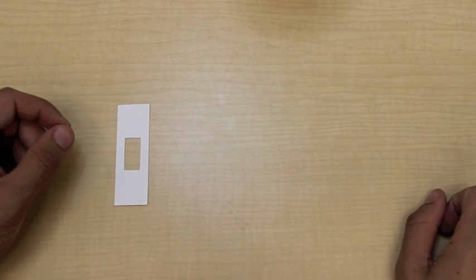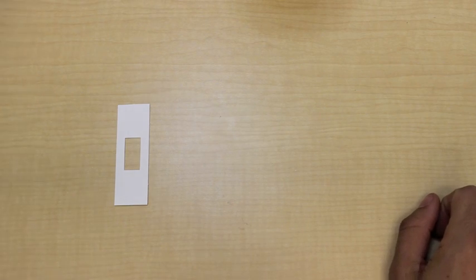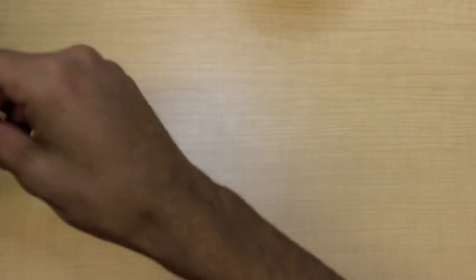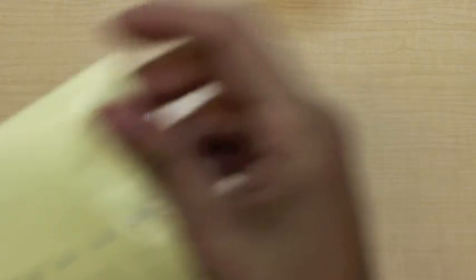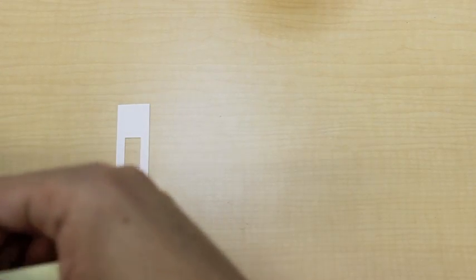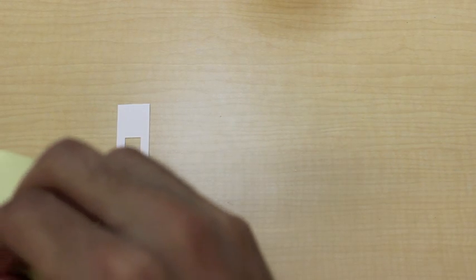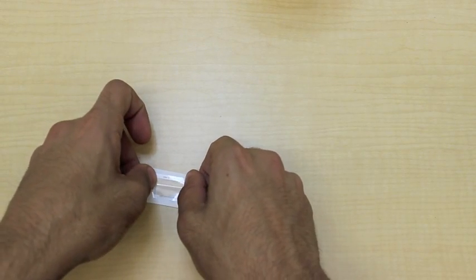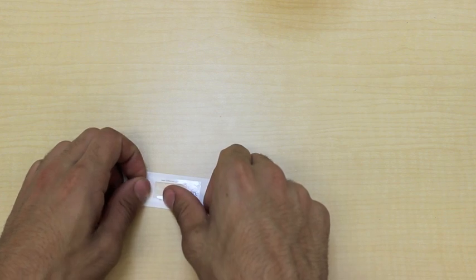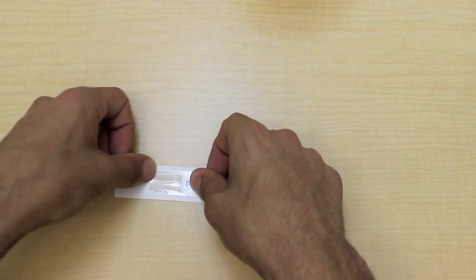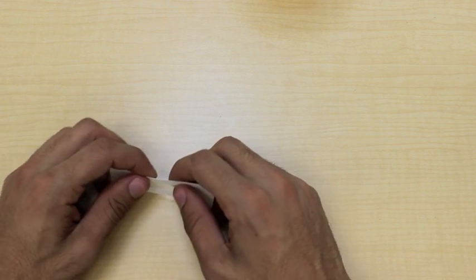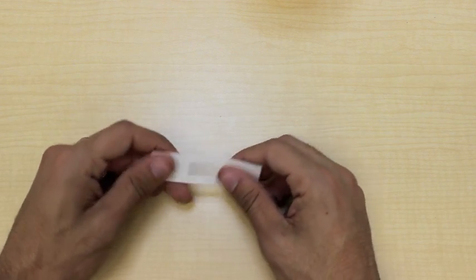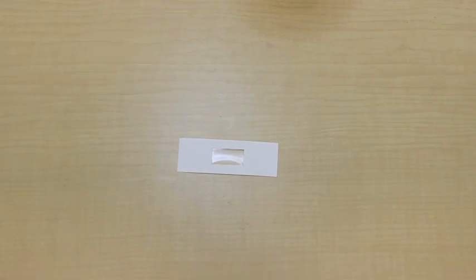Preparing a wet sample is very similar to preparing a dry sample. We'll start off by applying one of the stickers as a cover slip. I'm going to peel off one of the stickers and place it over the hole. Now, it's very important in this step to make sure you form a firm seal around the hole so that no liquid leaks out. And then, we're going to flip it up so that it's sticky side face up.